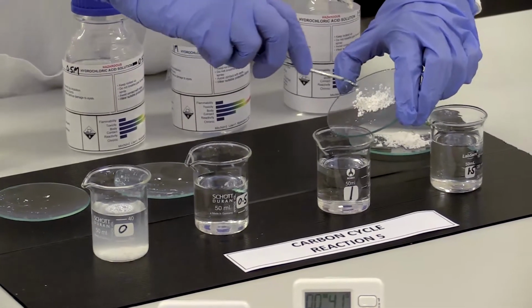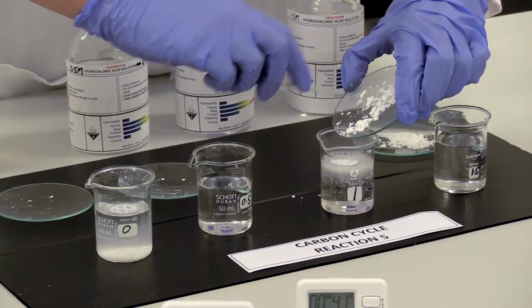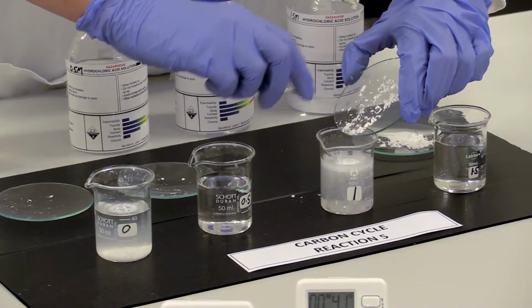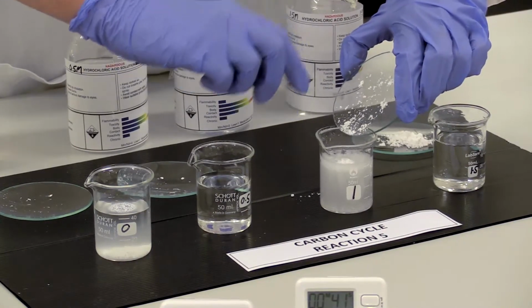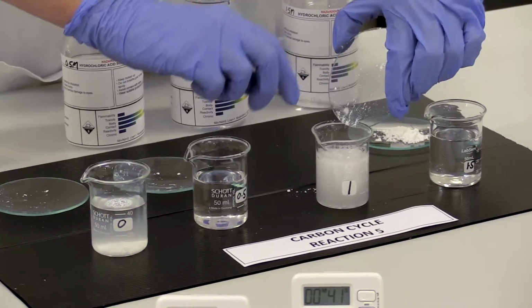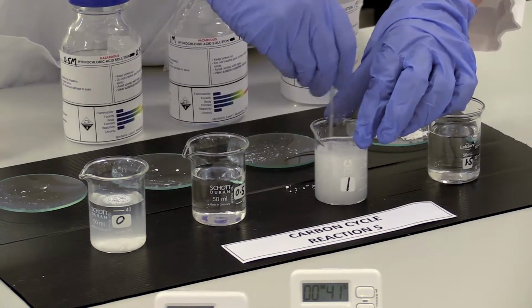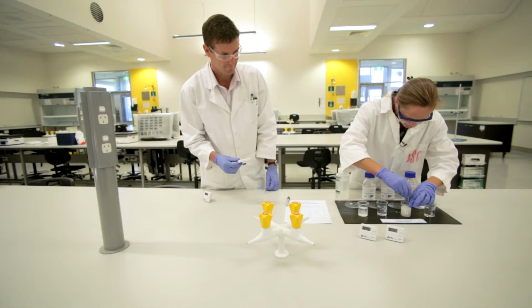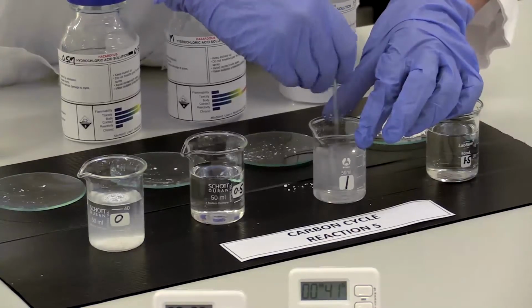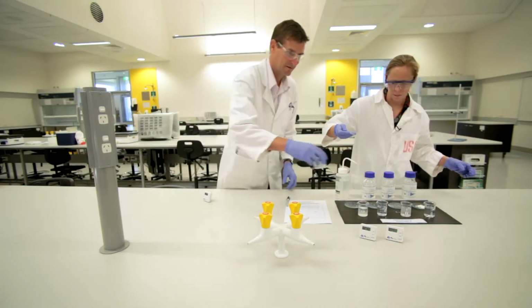And we can start the timer now. Okay, you can stop the timer now. 33 seconds.